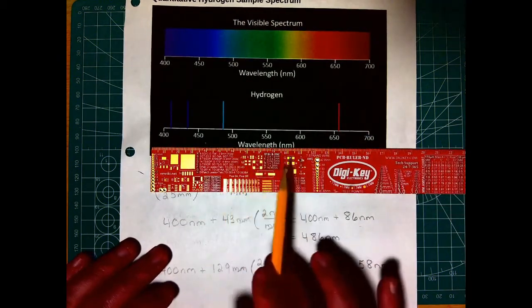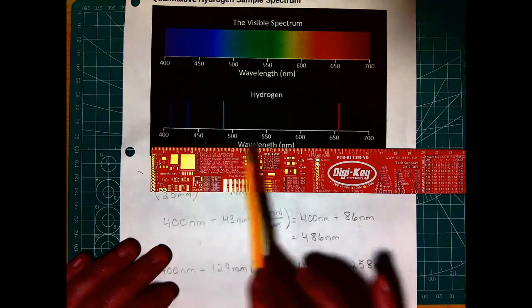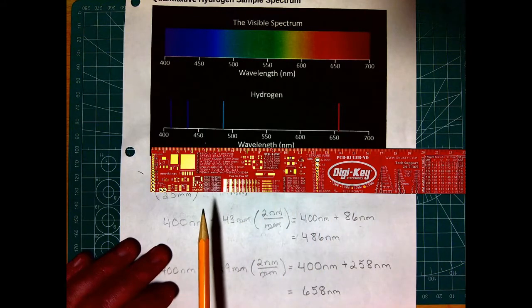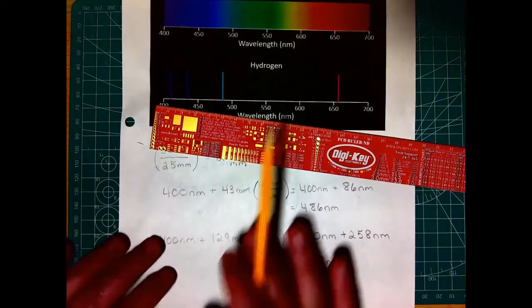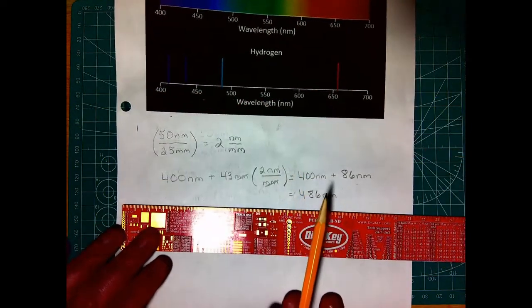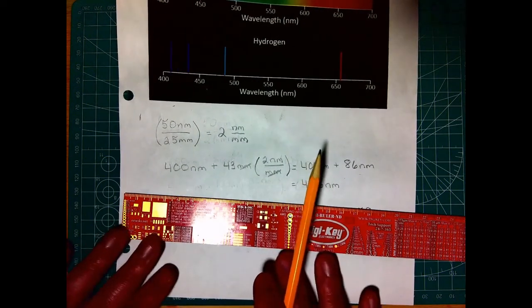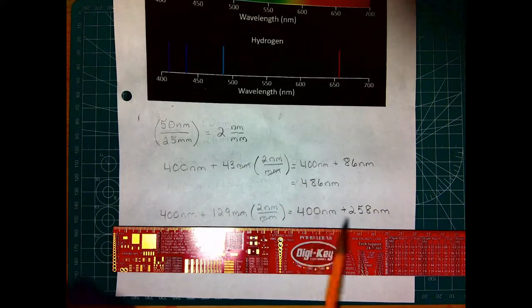And that's kind of the beauty of this technique, is it doesn't really matter what this looks like, just so long as this scale is here for us to work with. And we get pretty good values, not quite as nice as we could with some more sophisticated techniques, but given the equipment that we have in this lab and the data that we're given, these are going to be pretty good values for you guys to use to make up your graphs later.